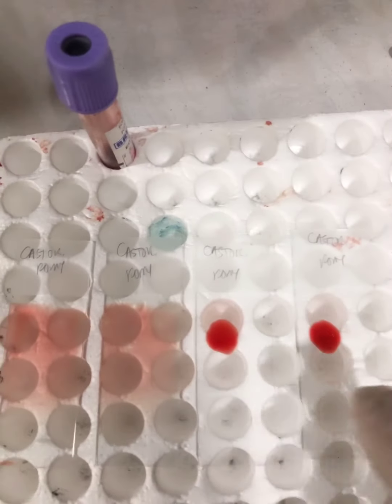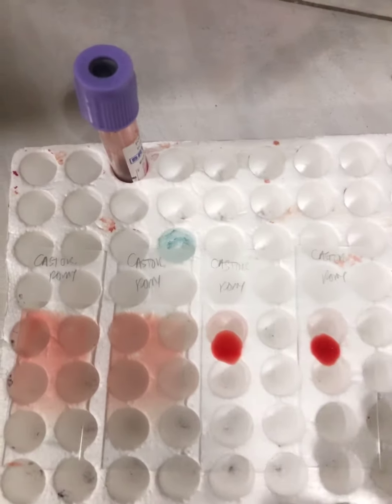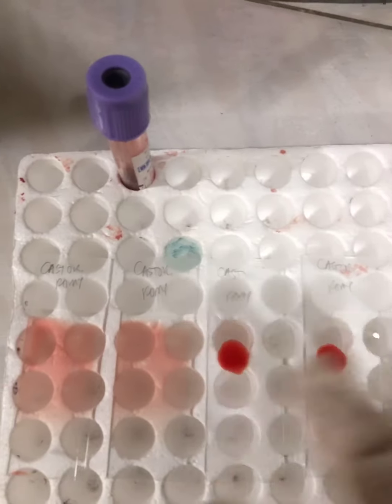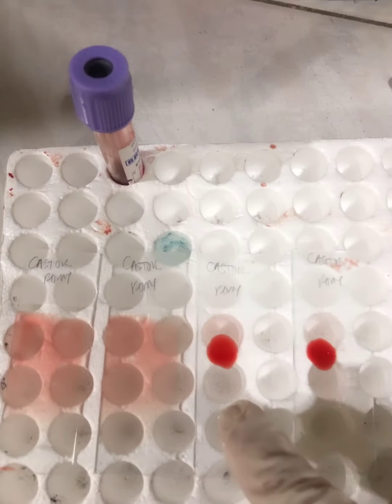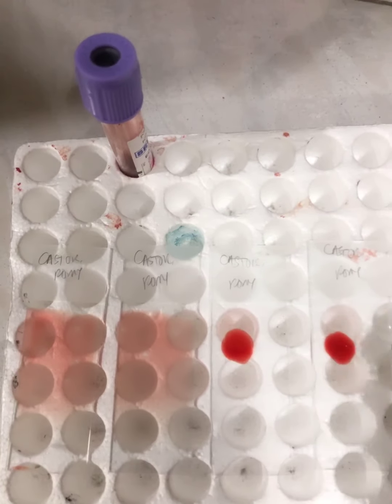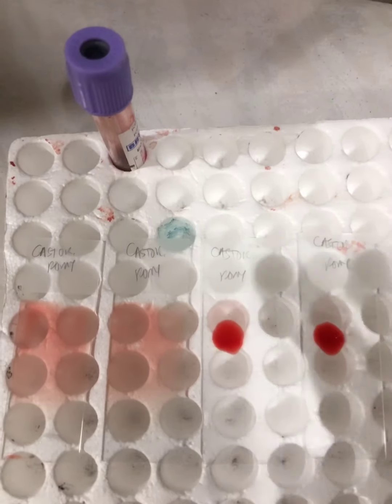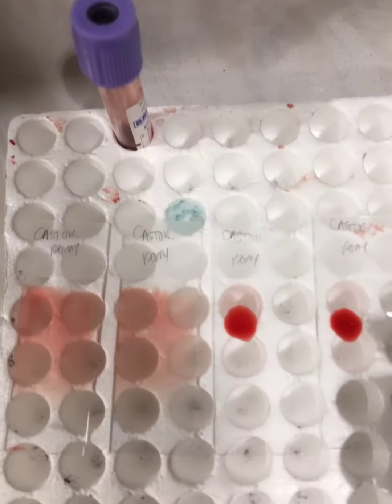For the thick smear, on the other hand, this slide allows us to recover the parasite, especially for light parasitism. So just let it dry first before we try to stain that one. But for the thick smear, you need it to undergo dehemoglobinization before you stain it. You can dip it in tap water in order for the hemoglobin to rupture, in order for you to identify the parasites.